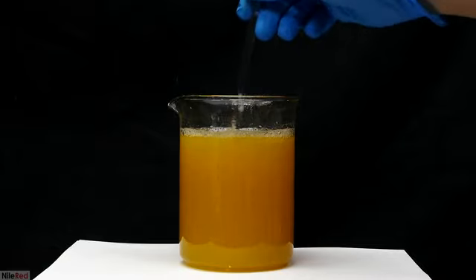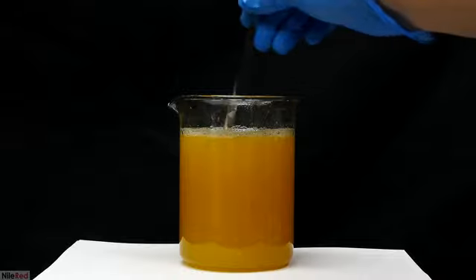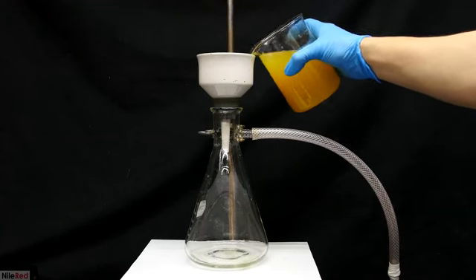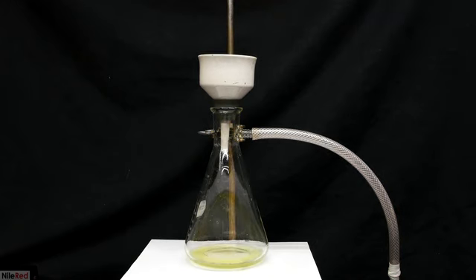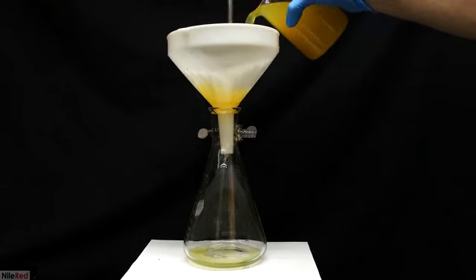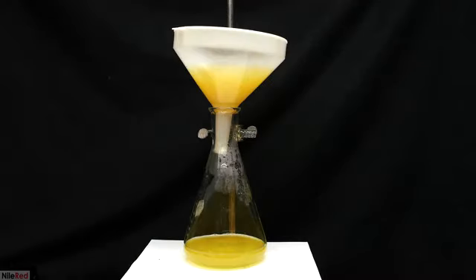Anyway, what we have here is a solution of sodium citrate with a lot of precipitate and pulp. We need to filter it off, but I don't really recommend using a vacuum filtration. The filter paper is very quickly blocked and liquid stops coming through. I found it was much more effective to just do a gravity filtration with some coffee filters. The filter here will also get blocked, but I found it was a lot easier to deal with.